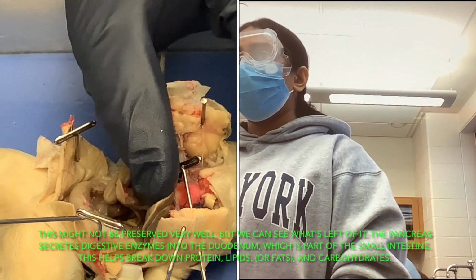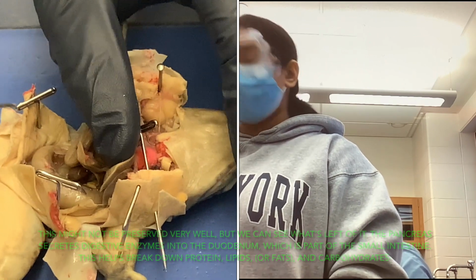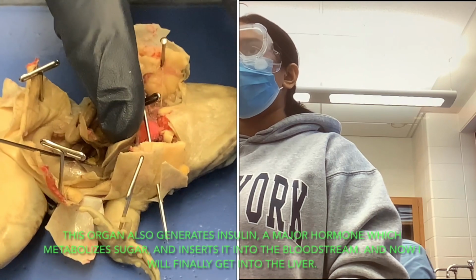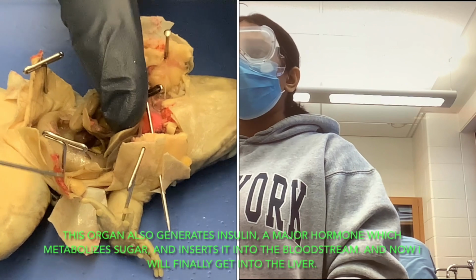This organ also generates insulin for the frog and, inside humans, the major hormone that metabolizes sugar is insulin, and it enters the bloodstream.